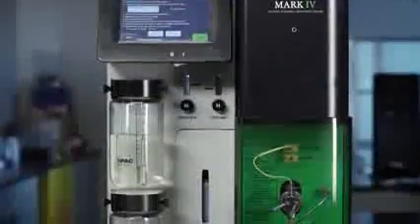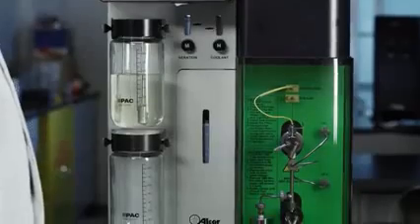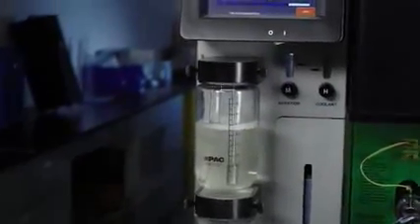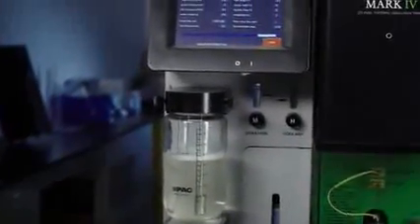Introducing the JFTOT 230 Mark 4. One of the features of the JFTOT 4 is that it is easy to work with. In this video we'll show you how to set up and run a sample.